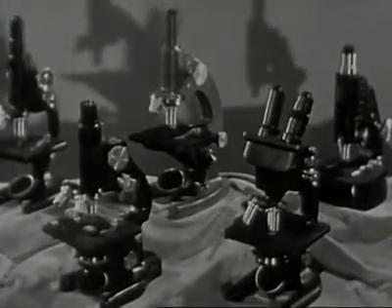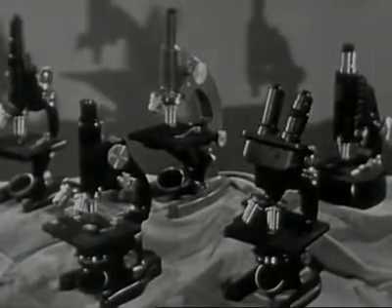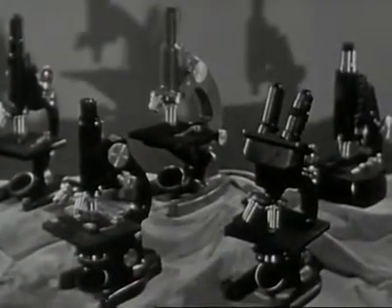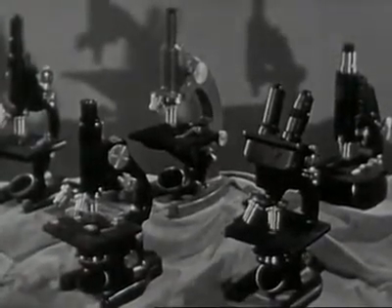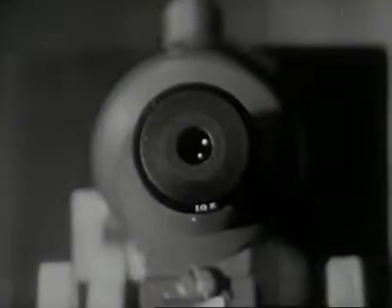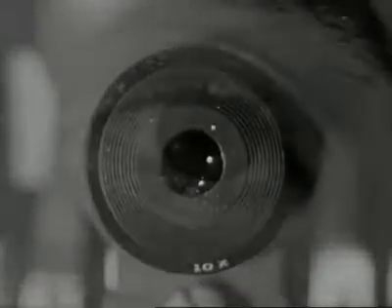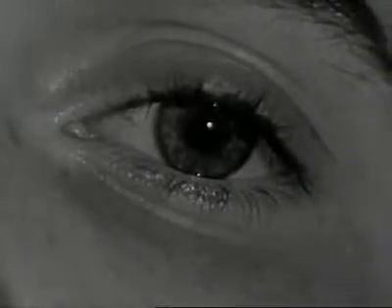But essentially, they are all for the same purpose: to magnify plant and animal life and other matter of minute size to a degree that it may be seen and studied. The powerful eye of the microscope extends the range of your eye when you use it correctly.